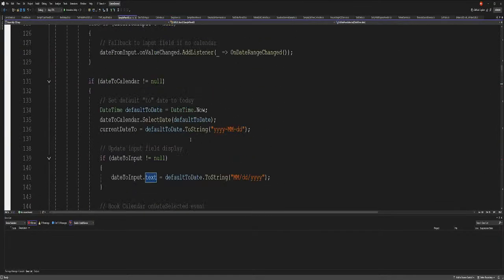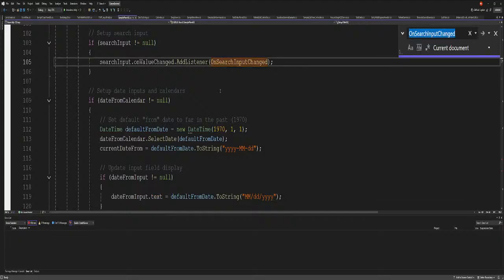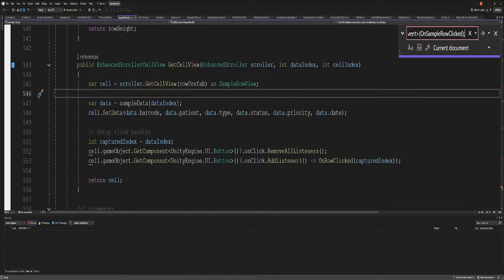Sample panel UI. Get cell view. So we have a get cell view size. I know that already. Skip fit. This is all for the enhanced scroller. Get cell view, and then okay, so we need to add an event in your detail windows. Did that already. Yeah, it's good.